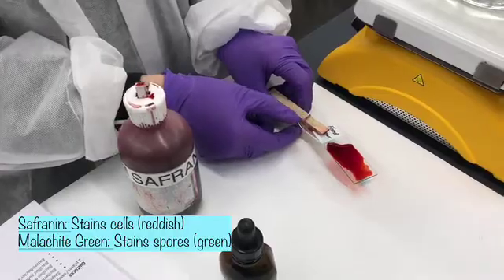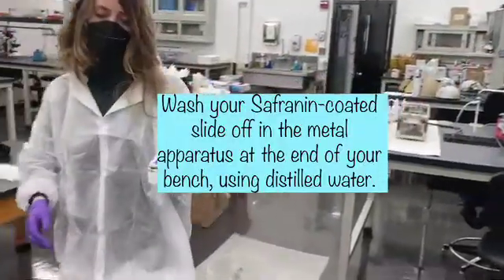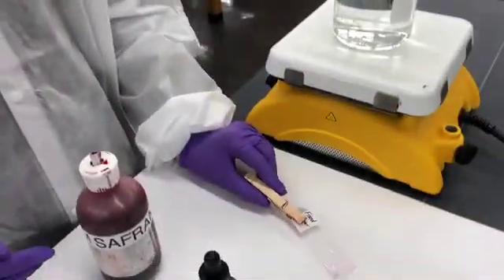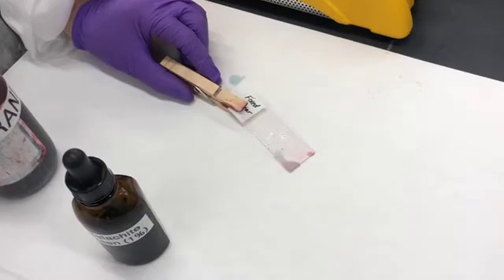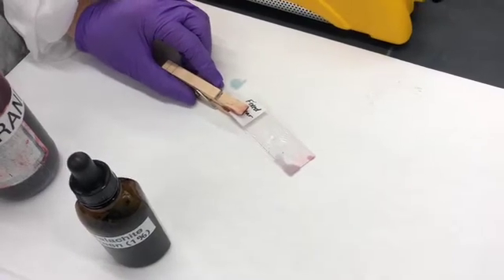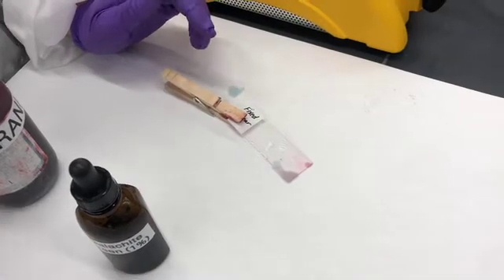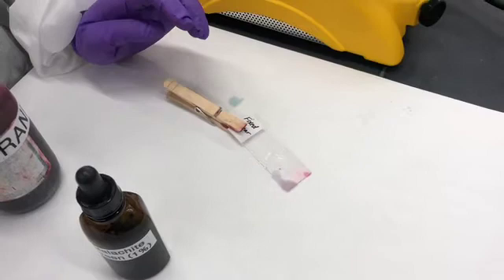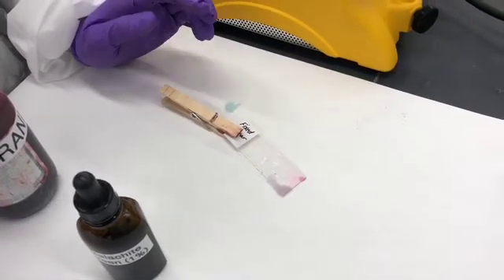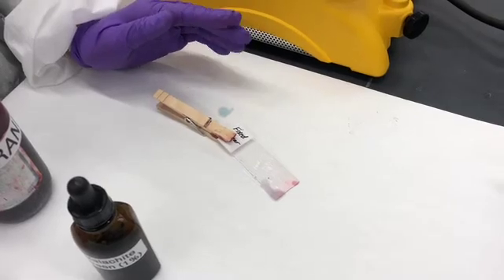So when you visualize, all the cells should appear red, and if you have any endospores, you might see green dots inside of some of the cells, or alternatively, you might see some tennis racket shapes or safety pin-like shapes. If there's green inside of them, that is a strong suggestion that your microorganism has the ability to form endospores.